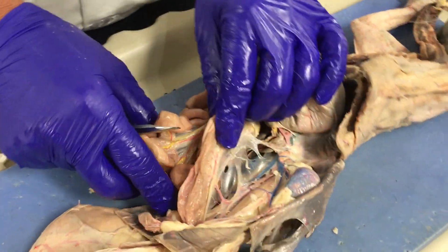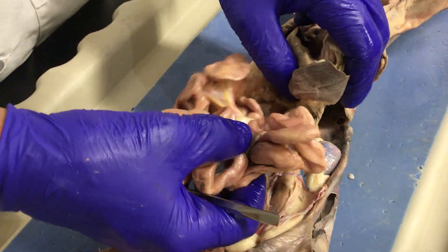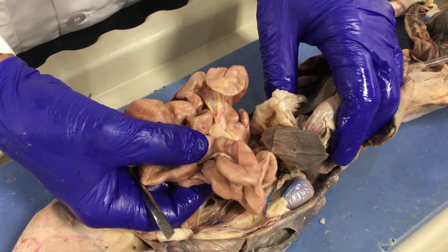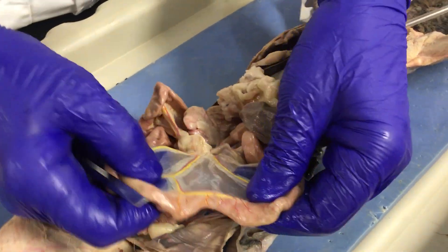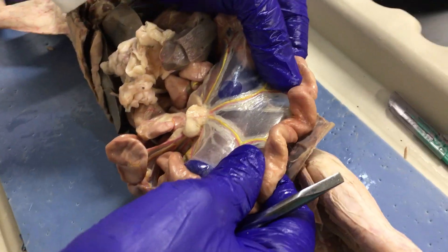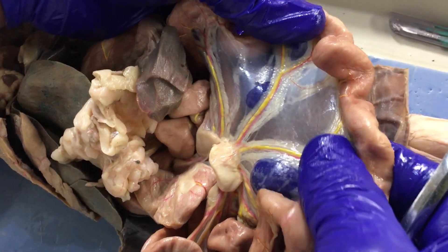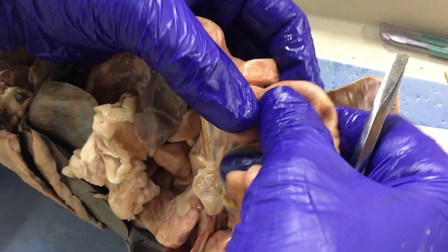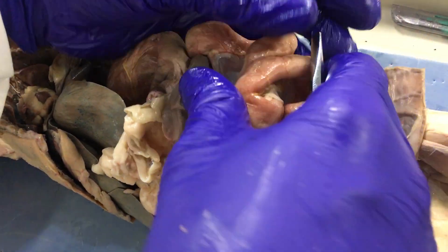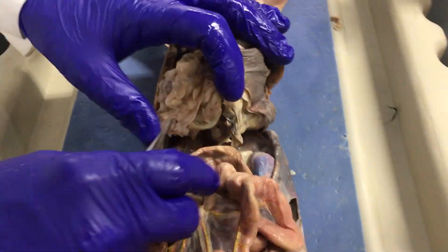Now the veins. The veins that come from all of these organs are part of the hepatic portal system. In this cat they were colored yellow to help us find them more easily. You can see all of the veins taking digestive nutrients are taking it to the liver. So the hepatic portal system.